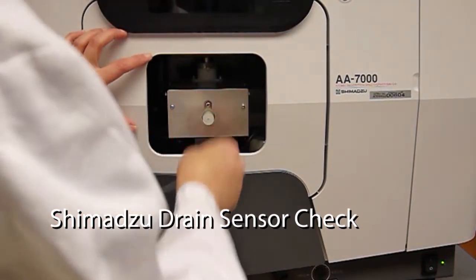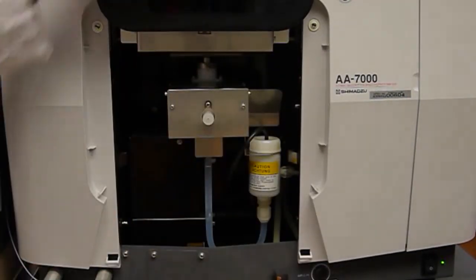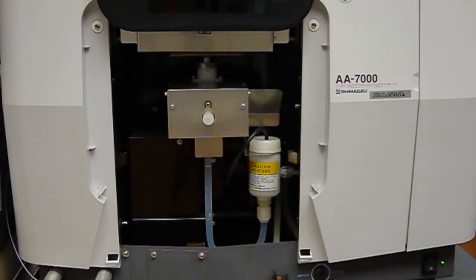We need to lift the drain sensor up above the water. So we're going to take out this and place it on the bench.